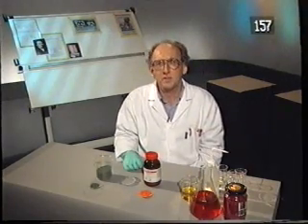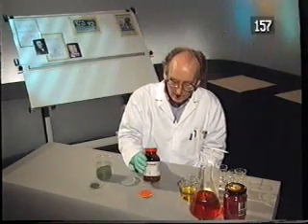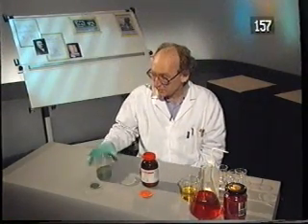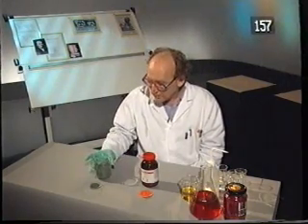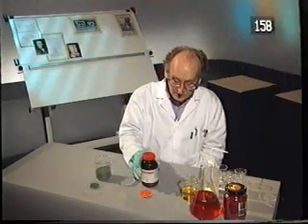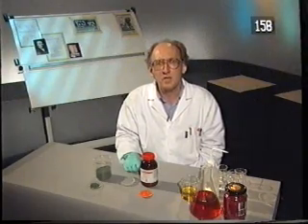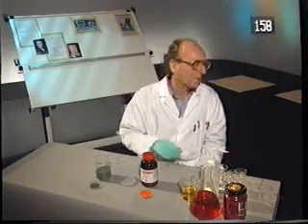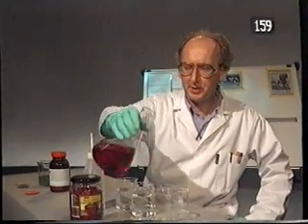Another important aspect of these reactions is that they only go one way. I can take my ammonium dichromate and react it to give chromium oxide, nitrogen and water. But I can't take this chromium oxide and react it with nitrogen and water and expect to get ammonium dichromate. We say the reaction is essentially irreversible. But not all reactions are irreversible. Here I've got some cabbage juice. It contains a red compound.